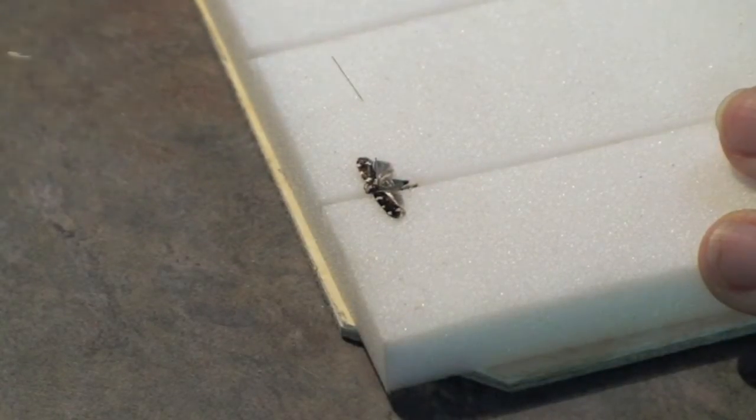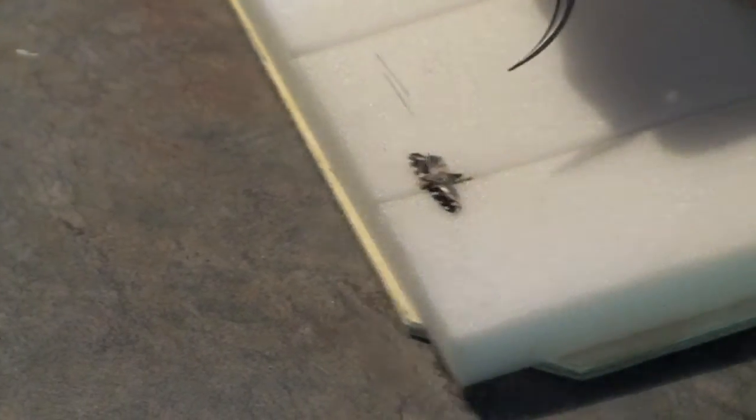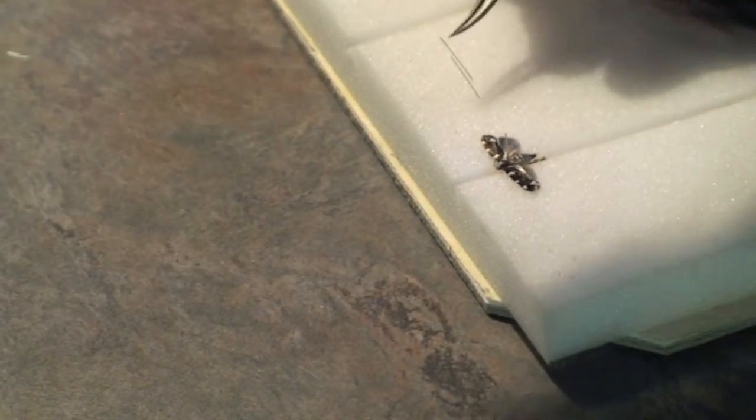Separate minutins are used to pin the wings into position, but these will need to be removed after the wing is held in place with the paper.